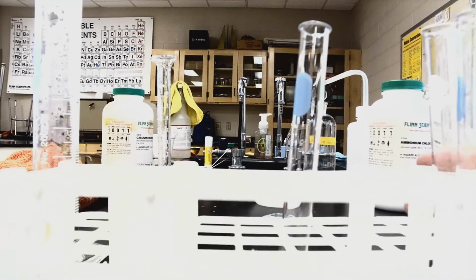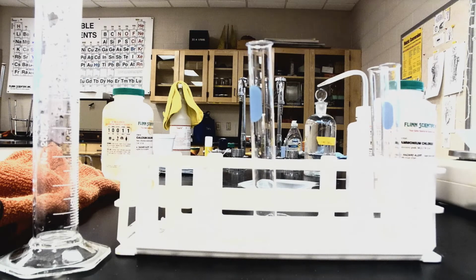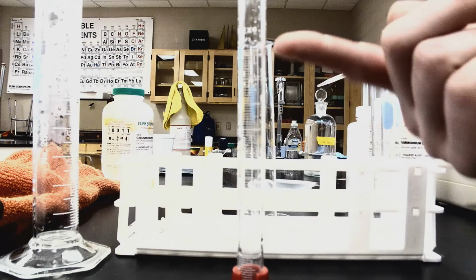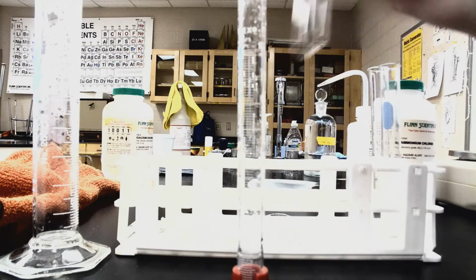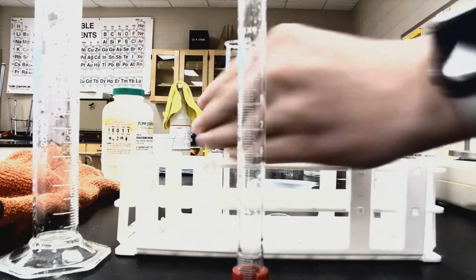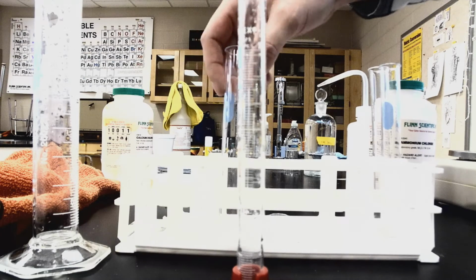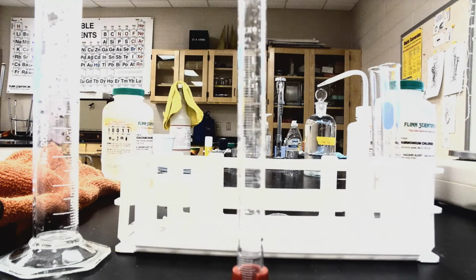All right. Our last reaction for the day is going to be our hydrochloric acid with sodium bicarbonate. I'm going to be pouring 10 milliliters of hydrochloric acid into my graduated cylinder. But before I do that, I want to make sure I add my baking soda into the test tube. So I'm going to get that added into there. Baking soda is a kitchen cooking ingredient. It's okay to get on your skin. That's why I took it out of the test tube to do that. So I've got my baking soda added to my test tube, as you can see.